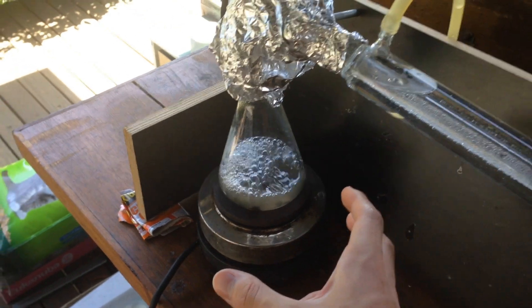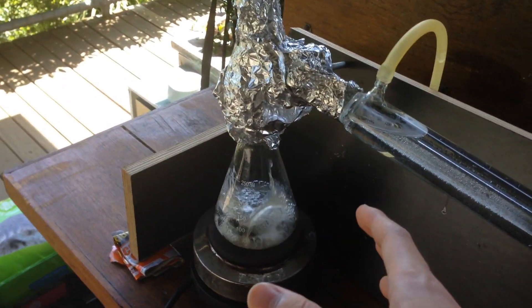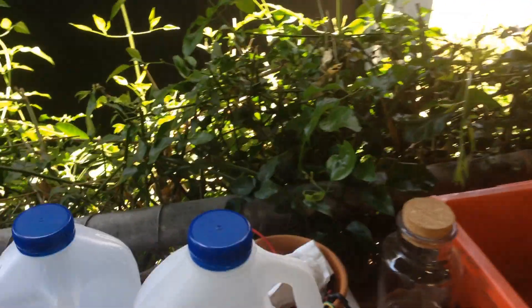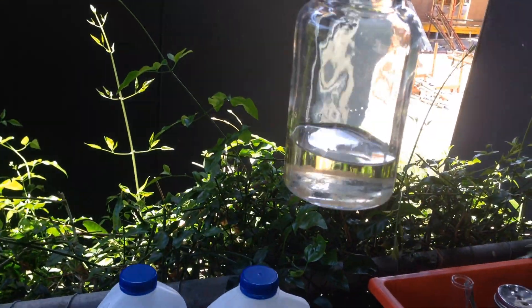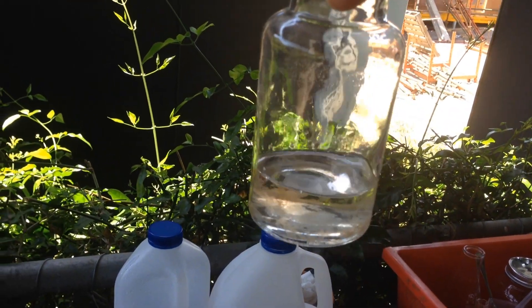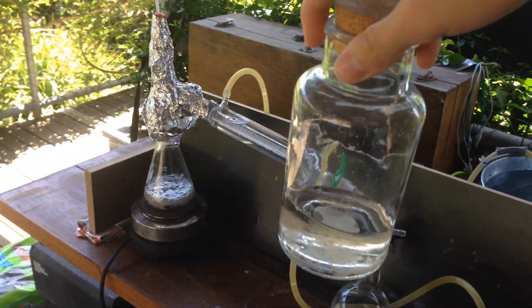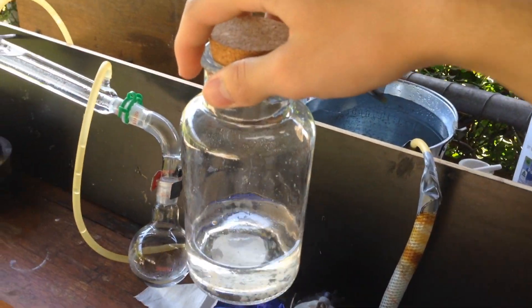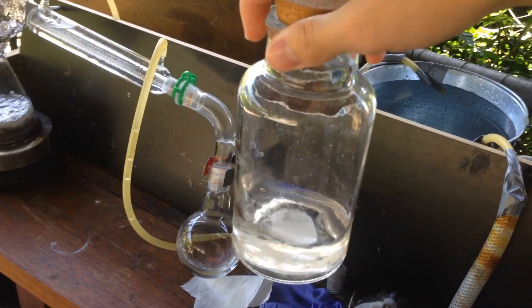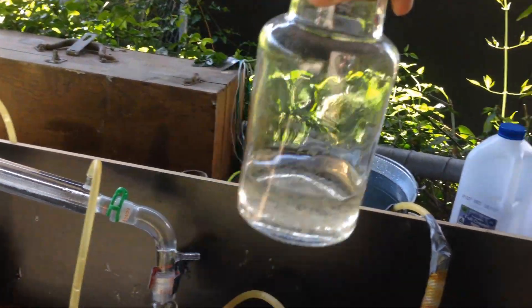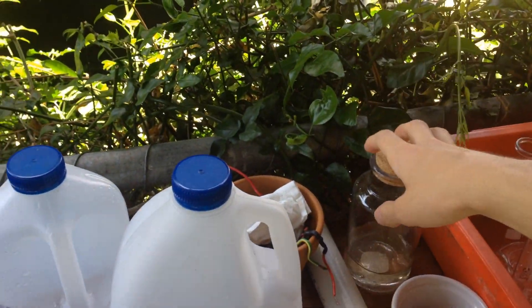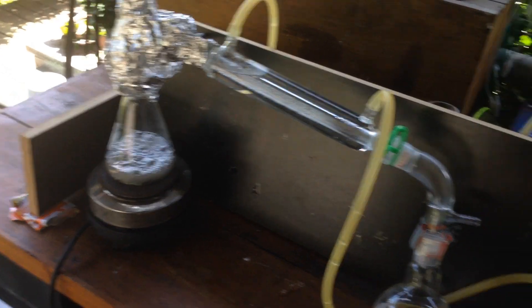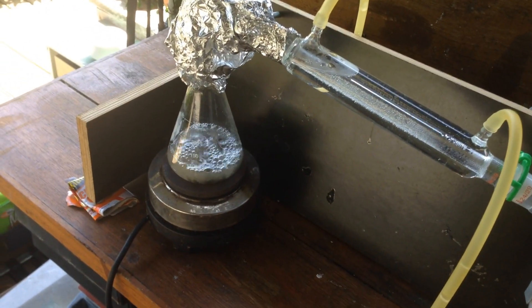What I'm doing with this concentrated stuff that starts boiling violently, when the distillation stops, I'm putting it in this container over here, which has got our concentrated sodium sulphate solution, and I'll try distilling that as much as I can. Then I'll put this in the fridge, and hopefully we can crystallise out most of the sodium sulphate, because we do actually want all the water from here, as it is still highly concentrated in deuterium.